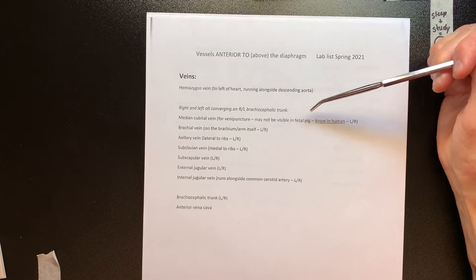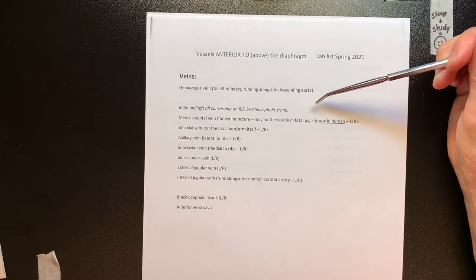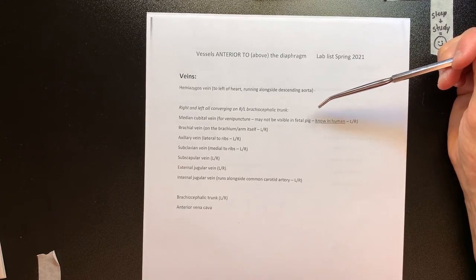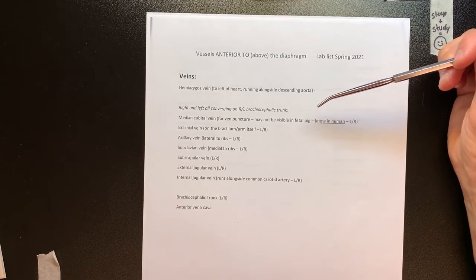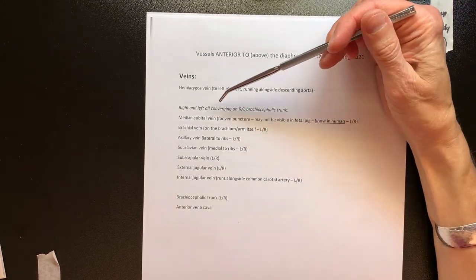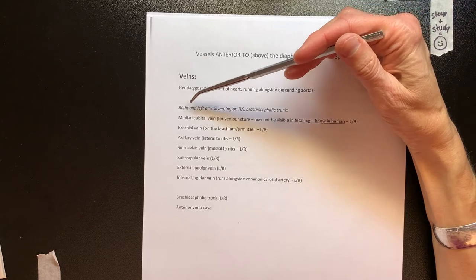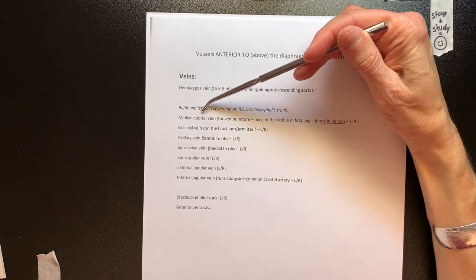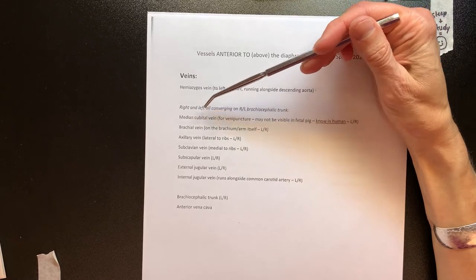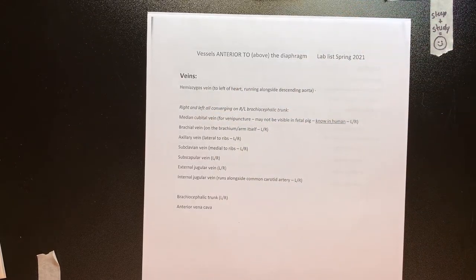The first branch, starting from the most distal point — because these are veins returning back to the anterior vena cava, or what you know as the superior vena cava in humans — the first branch furthest out at the elbow is called the median cubital vein. Median means middle, cubital means elbow. So this is the vein on the anterior portion of the elbow.